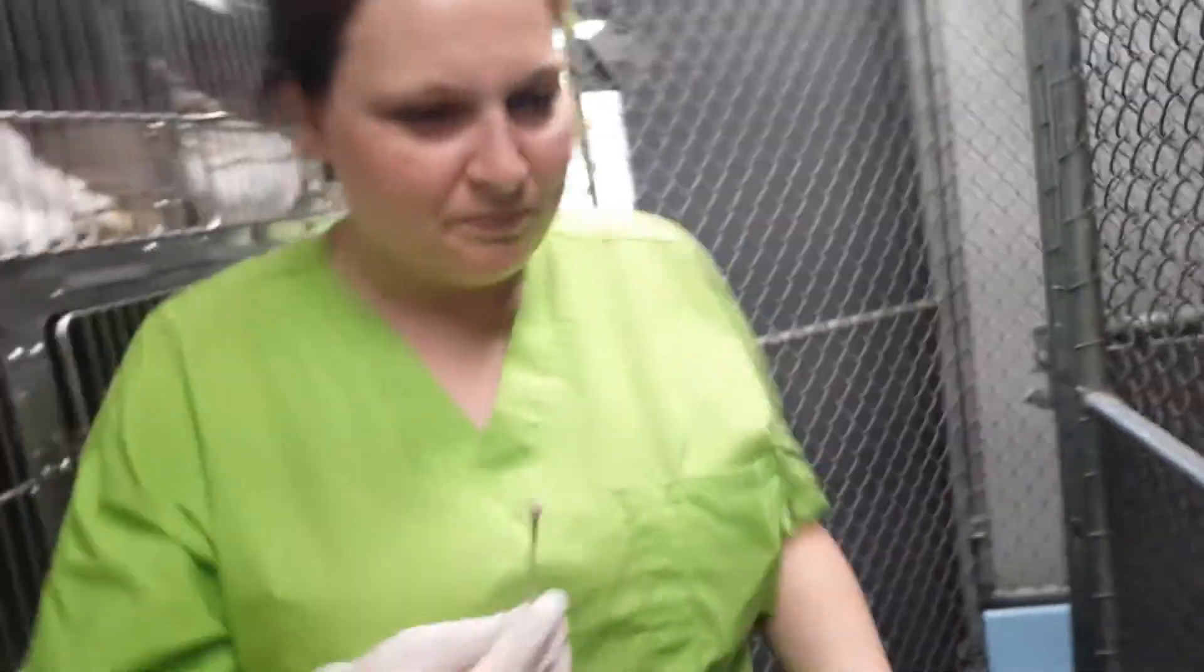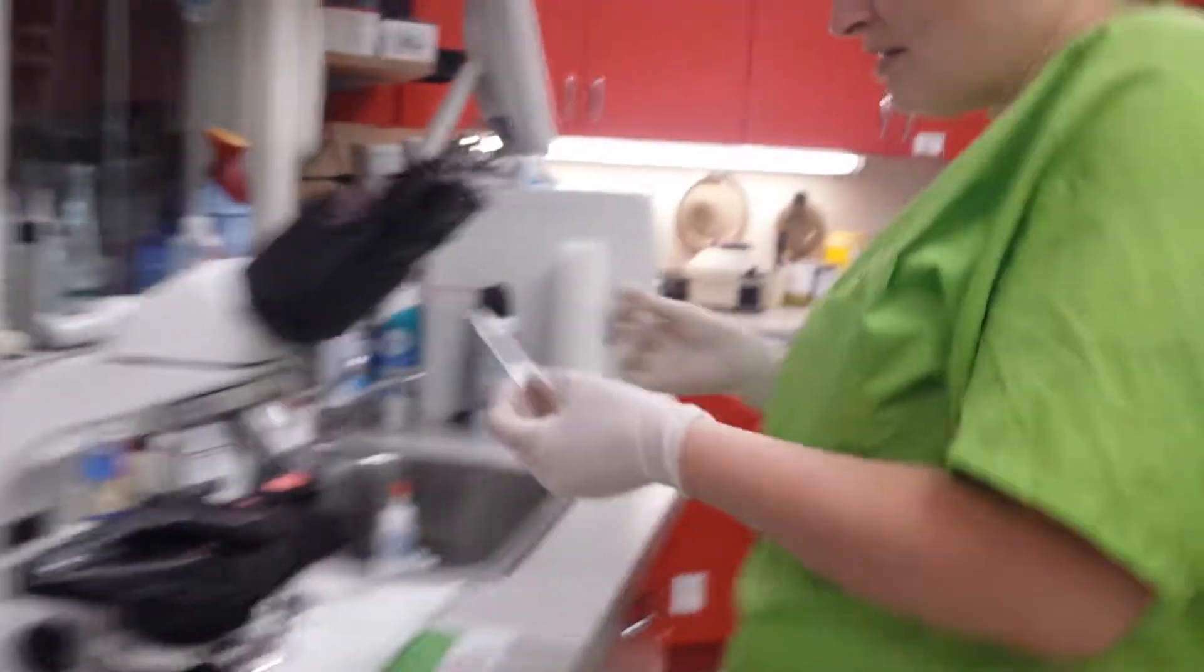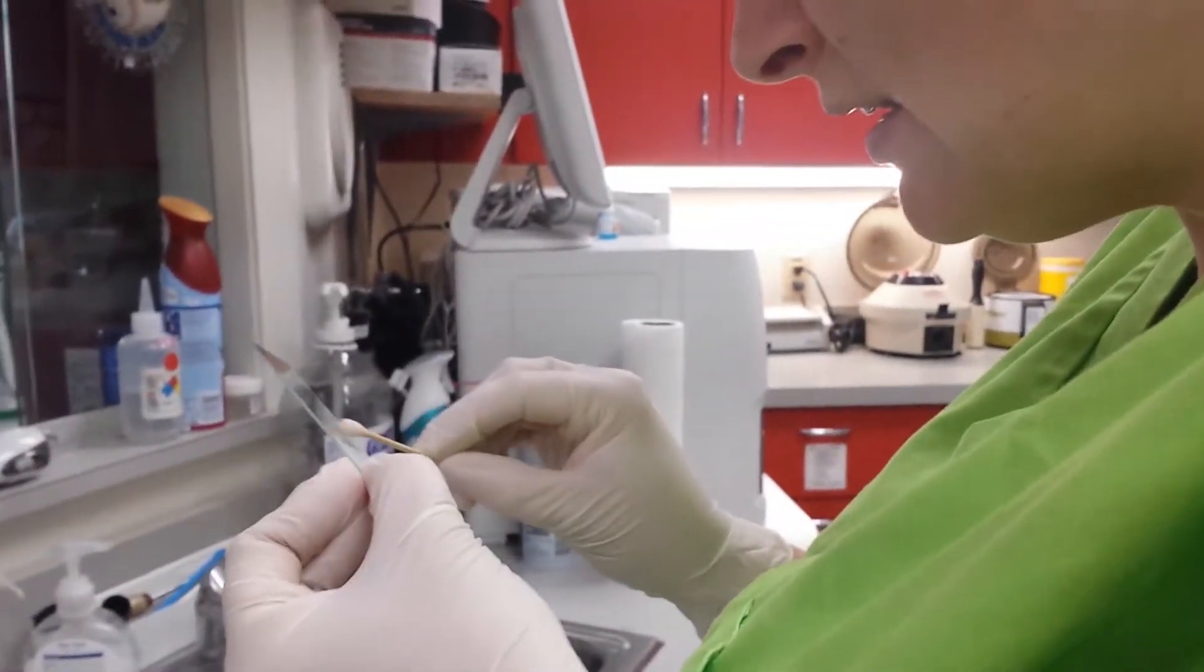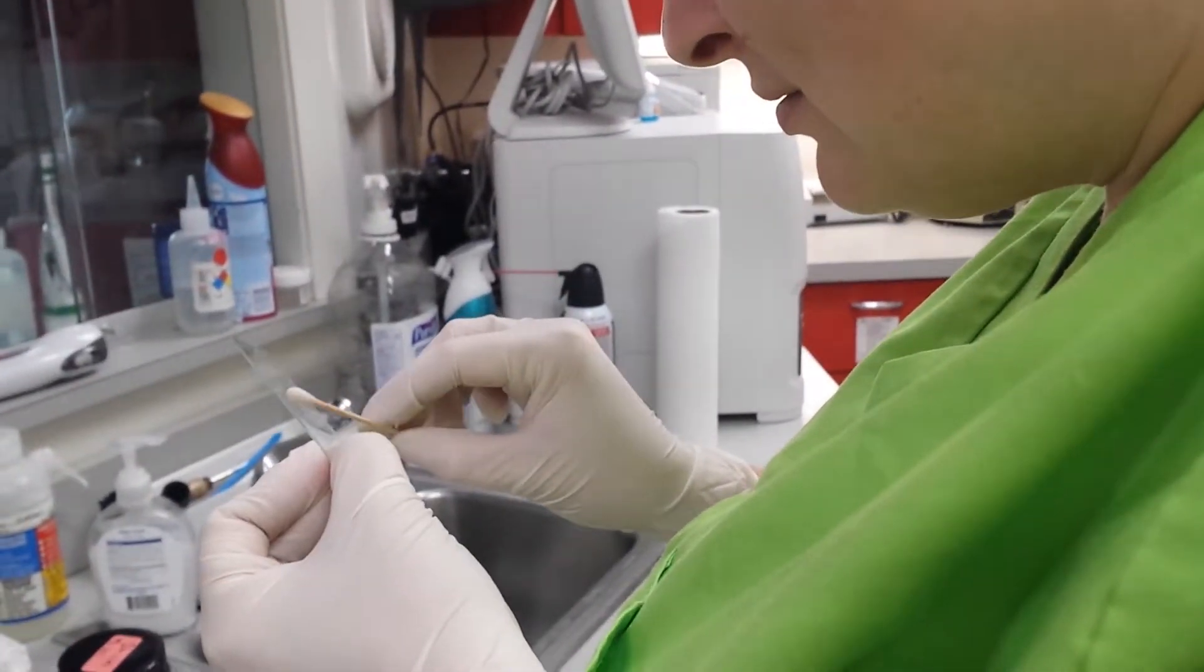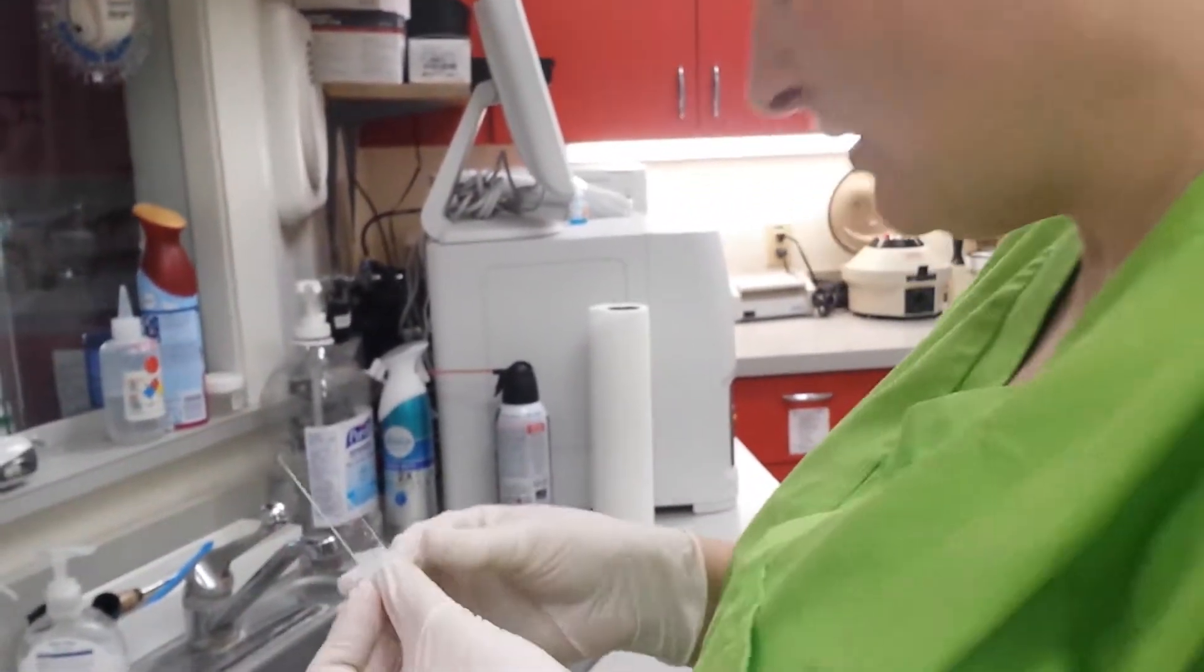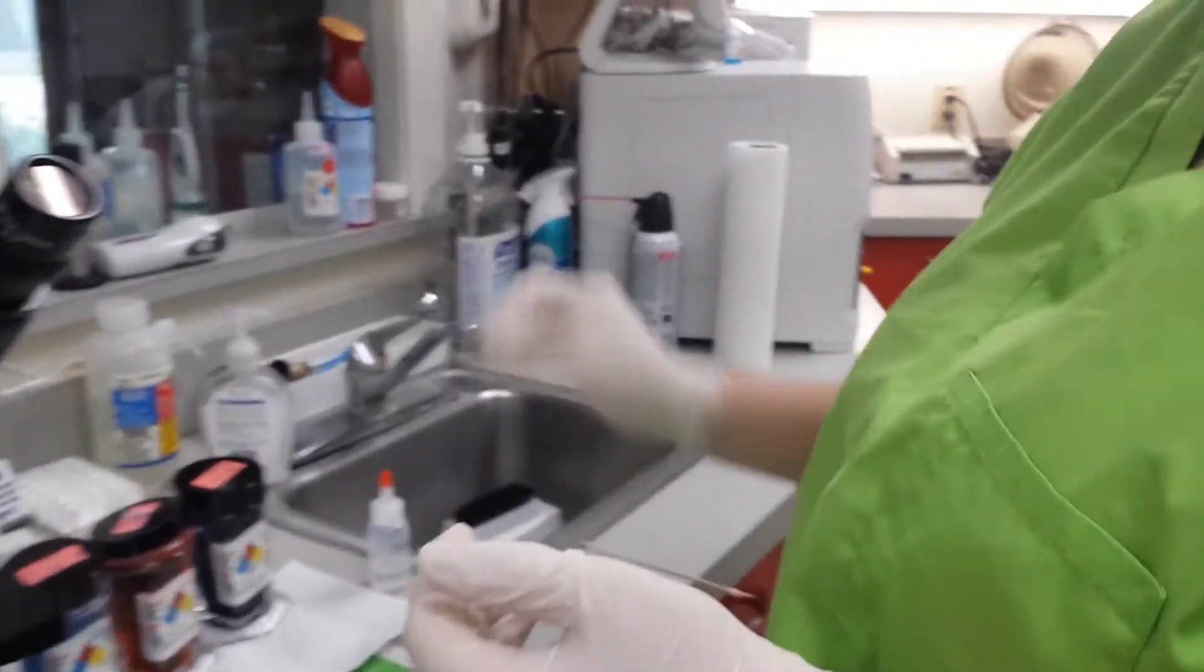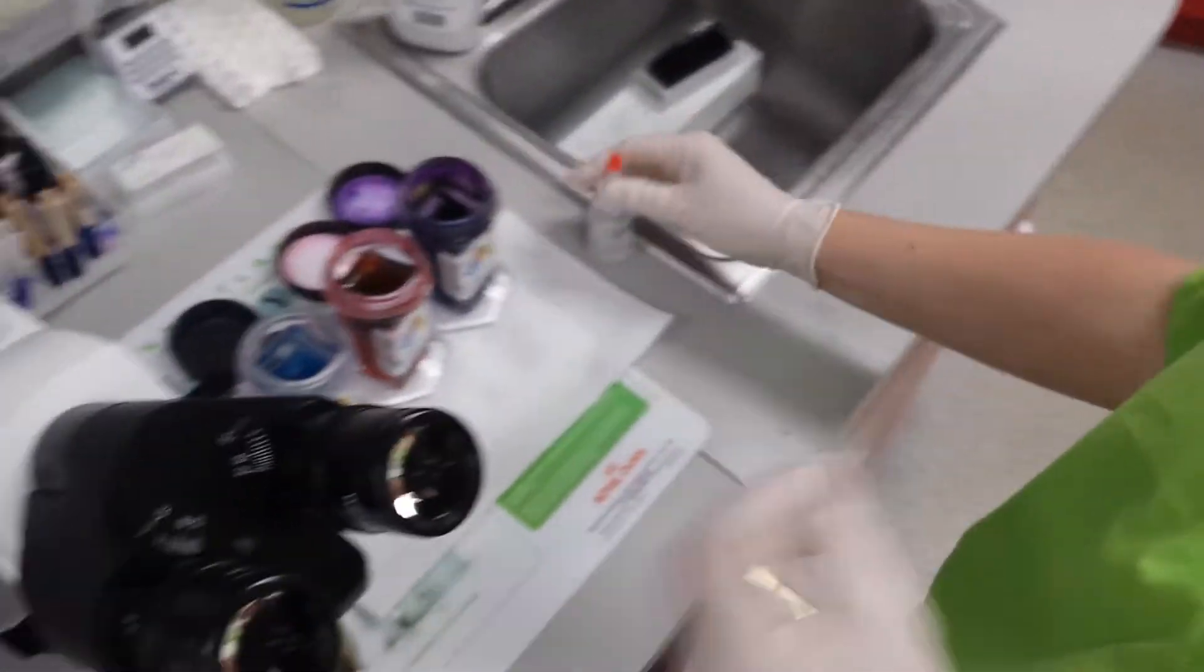We're at our clean slide, and you're going to go ahead and evenly roll out the smear. Then we're going to air dry it here for a quick second. While we're doing that, we're going to open up our stain and our sterile water.